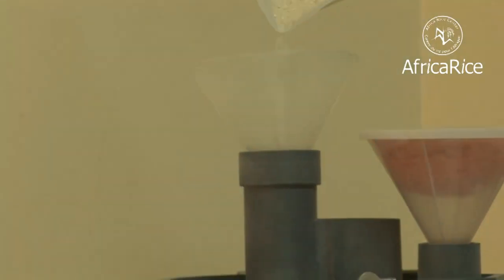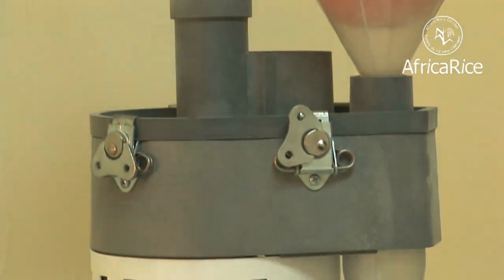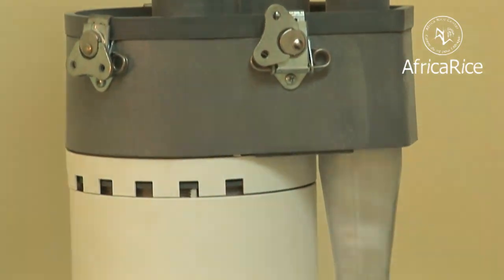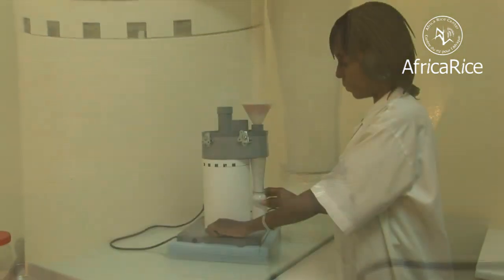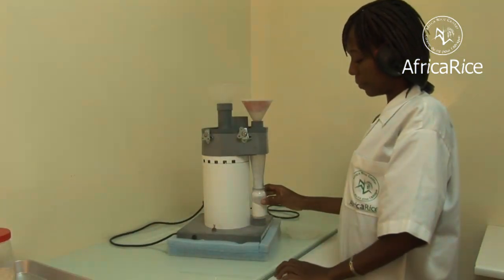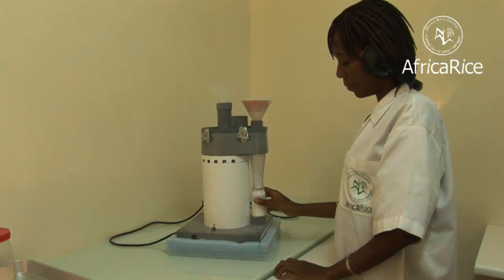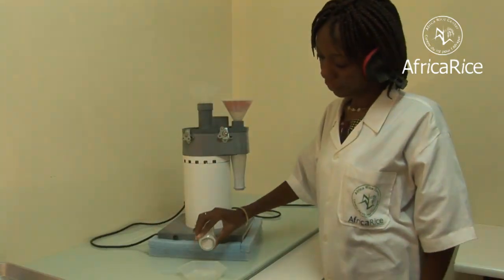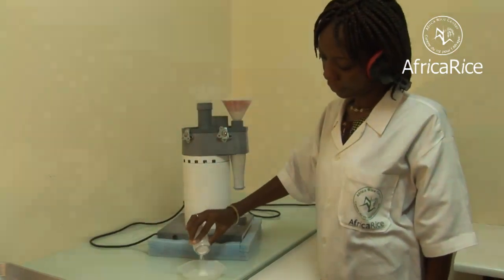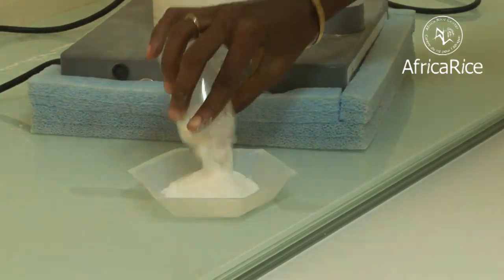After milling, several other analyses can be carried out on the grains, and for some of these analyses, the grains should be milled into flour. To do this, a cyclone mill is used, which ensures that the grains are milled into very fine flour for subsequent utilization.